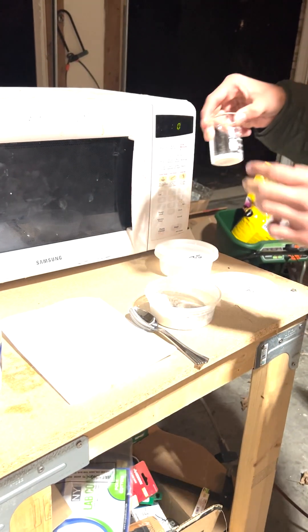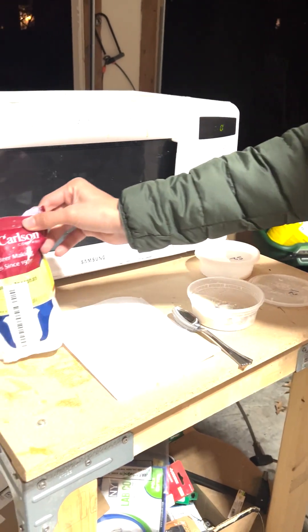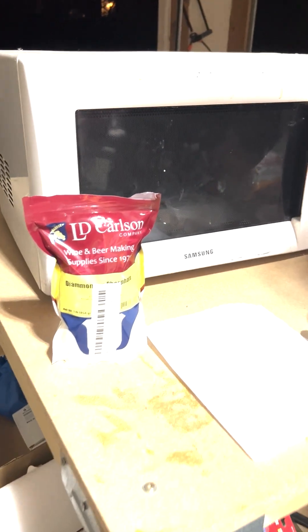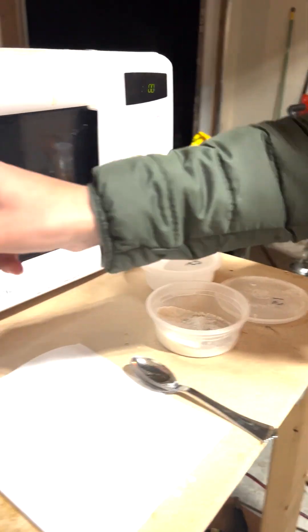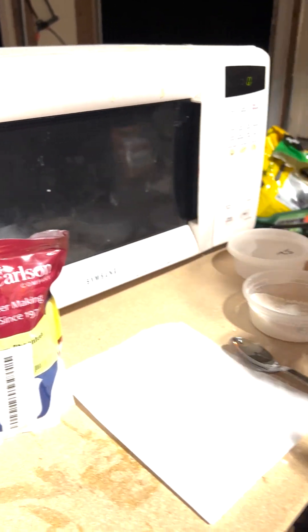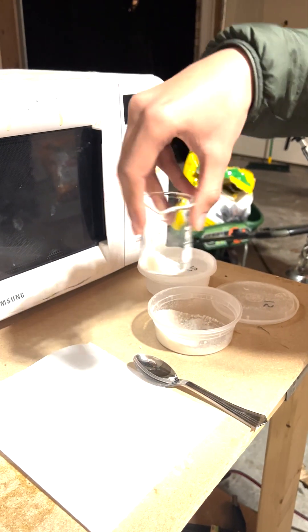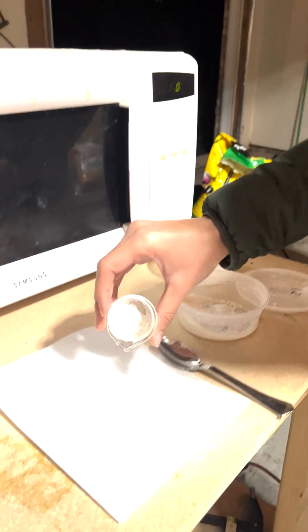Right, so what we have here is the mixture in powder between our diammonium phosphate and our calcium acetate. We have 1.67 of this to one molar ratio of this, and I'm just gonna swirl this around, and put it on some paper.